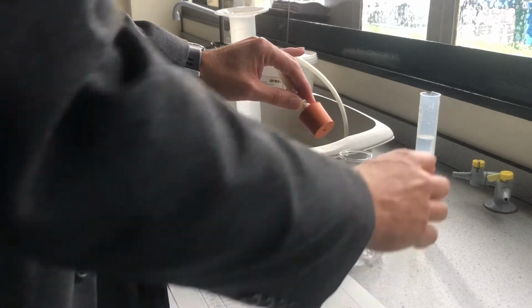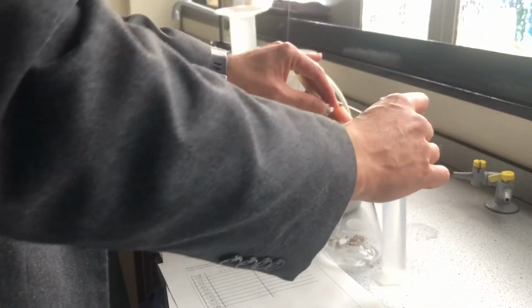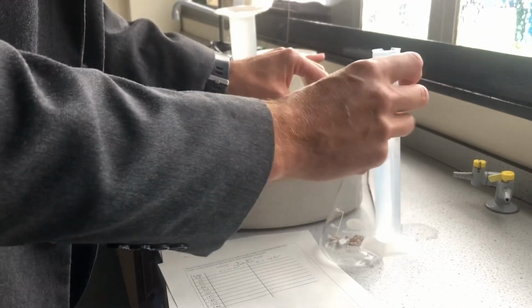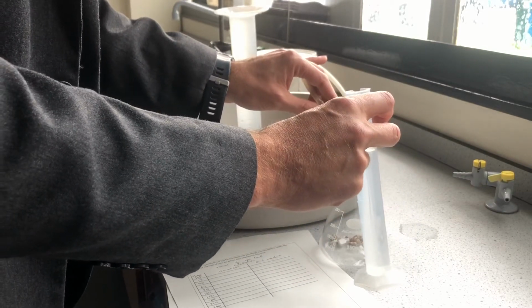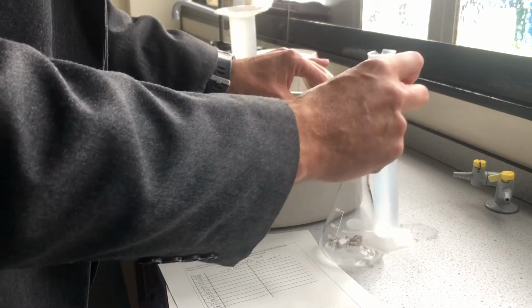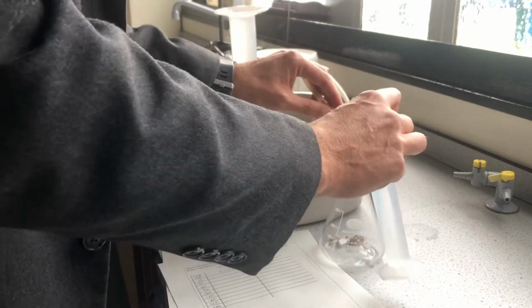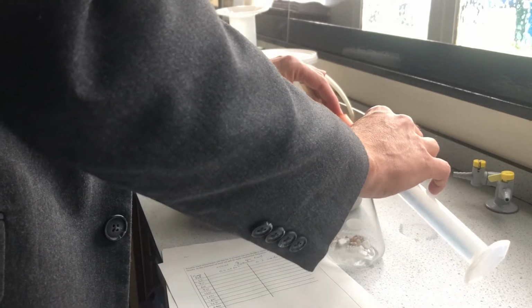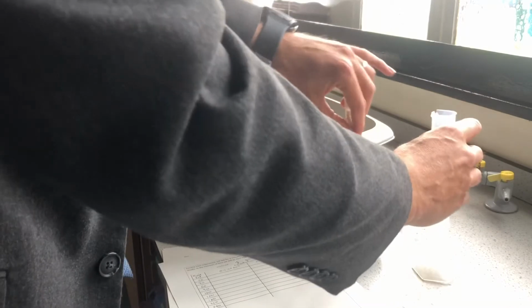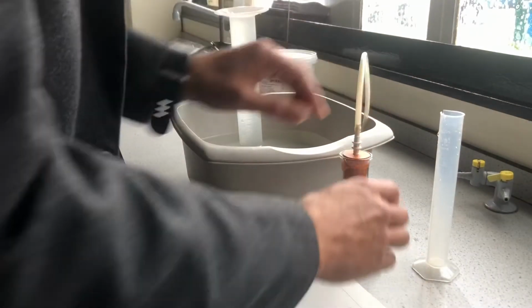The biggest problem is I've got my acid here, I'm about to tip it in. When I tip it in, if you remember, the reaction goes quickest at the start because this is absolutely rammed full of acid particles. As the reaction goes on, those acid particles are used up, so there's fewer collisions as time goes by. So it's quickest at the start, as we tip it in here, and the bung is not in there. It takes me a moment to get the bung in, so there is a source of error there.